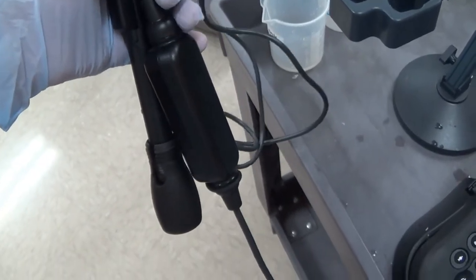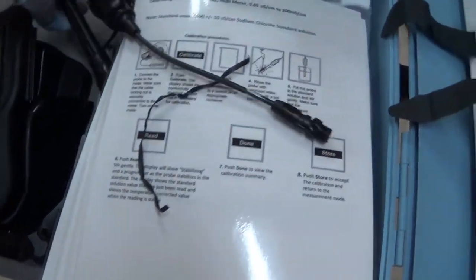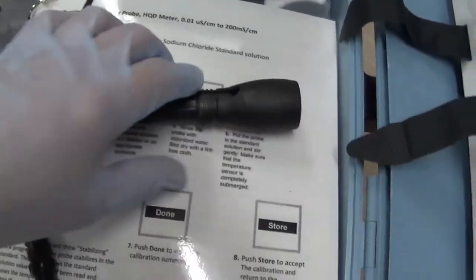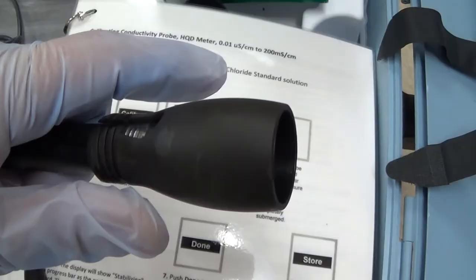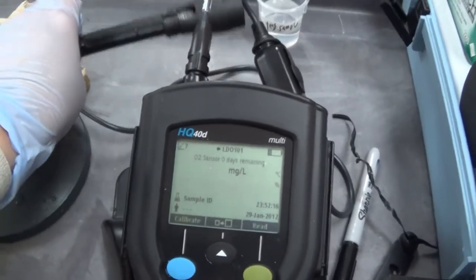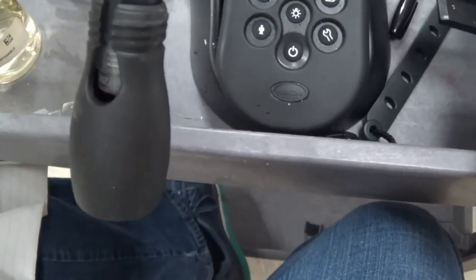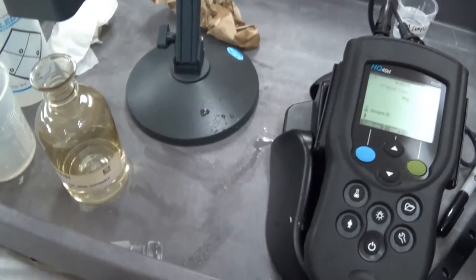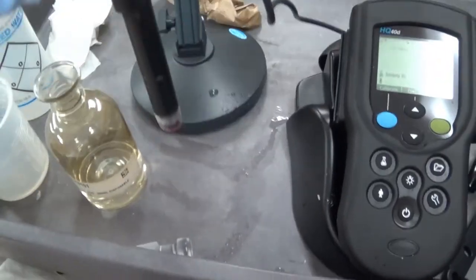This is the dissolved oxygen probe. Like the others, these are four prongs. I am going to hook it into the same spot. This is a protective cover here that can be removed. I have connected the probe. Now I am going to remove the protective base. I believe it just pulls right off. I am going to put it in our usual stand here.